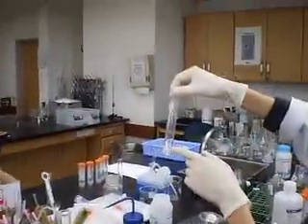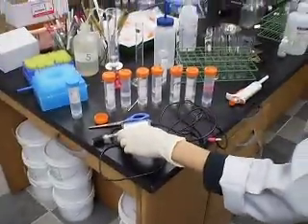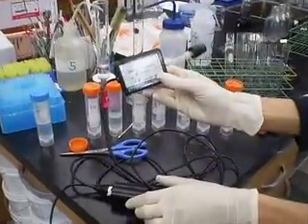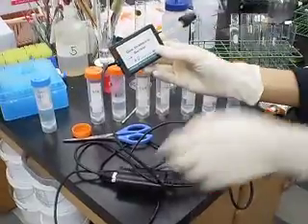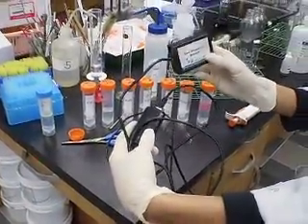So we confirmed it reacts with the concentrated solution. How are we going to measure the hydrogen gas? We are going to use a sensor — two types of sensors. This is a gas pressure sensor. It will measure the release of hydrogen, and we are going to link this to Logger Pro.